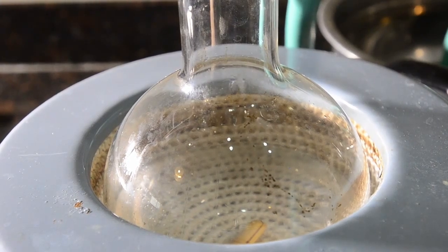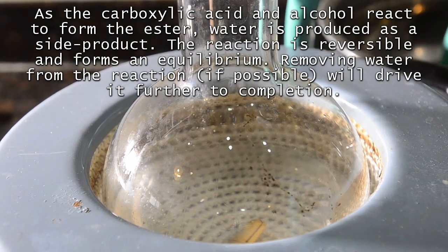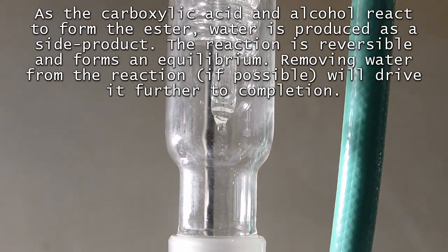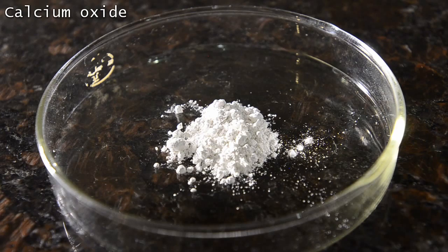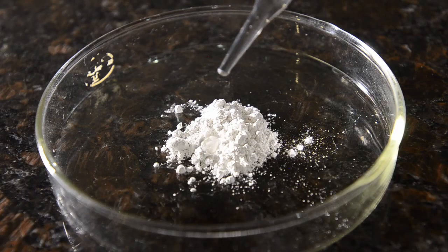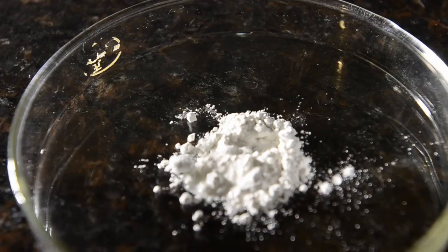As the reaction occurs, water is produced, and together with the ethanol this distills off as an azeotropic mixture, condensing in our reflux condenser and then dripping back into the mixture. Our plan was to try to remove this water during the reflux process. This is calcium oxide. It reacts with water to form calcium hydroxide, which is also a solid. Both of these compounds are insoluble in ethanol. Let's see it react with a few drops of water. There's no obvious reaction, but the mixture heats up and you can see some steam being given off.